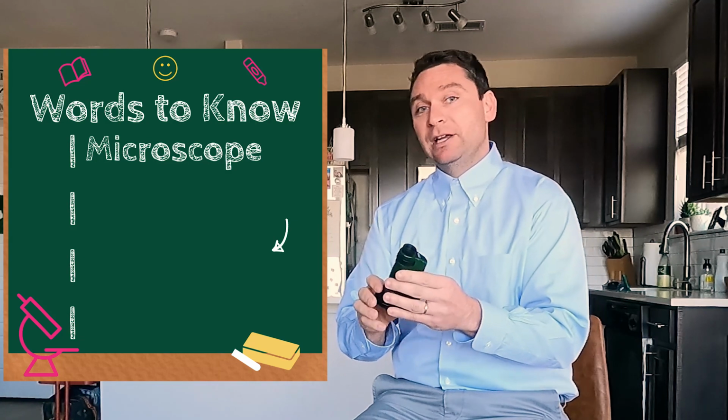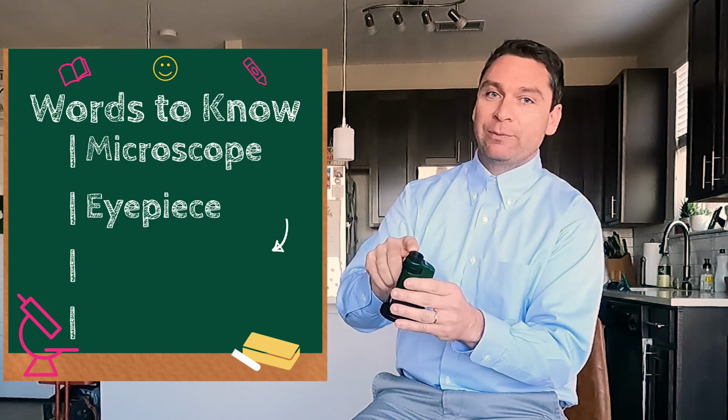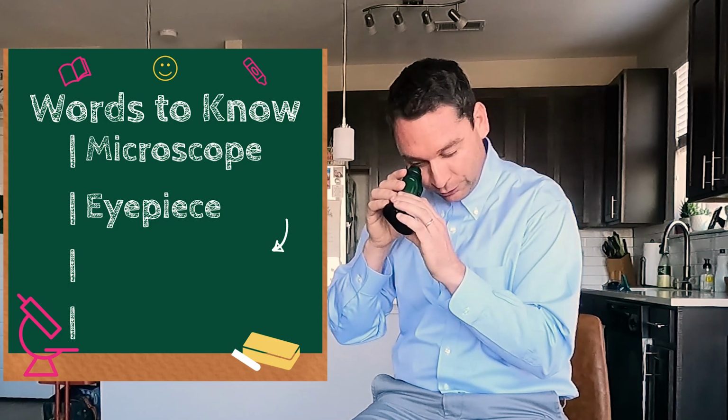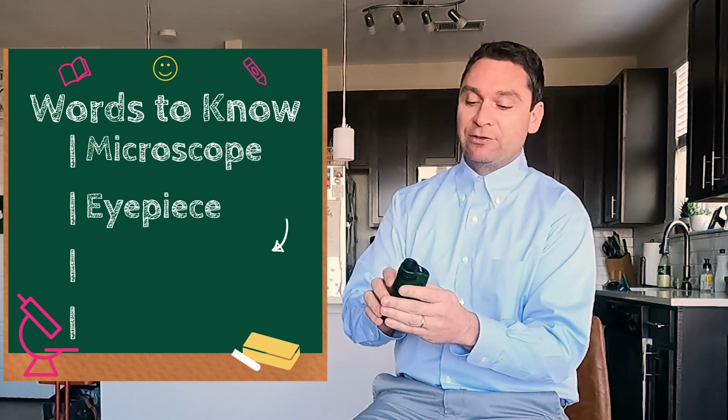Now, our next word is eyepiece. And at the top of the microscope is the eyepiece. This is where you look through it. Your eye goes there. So on top of the microscope is the eyepiece.